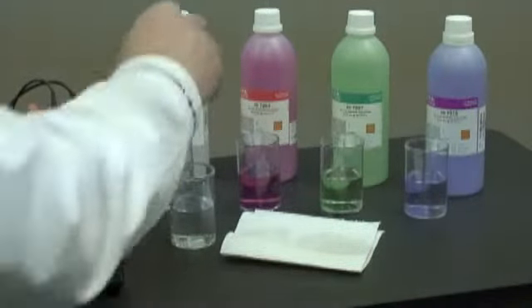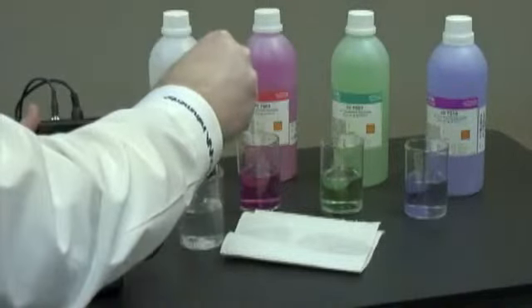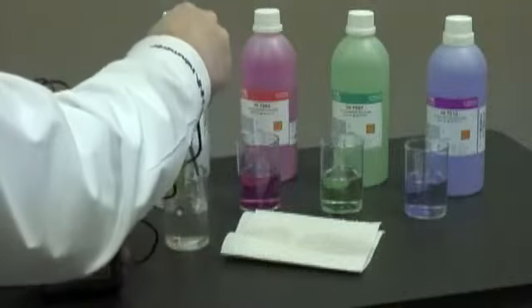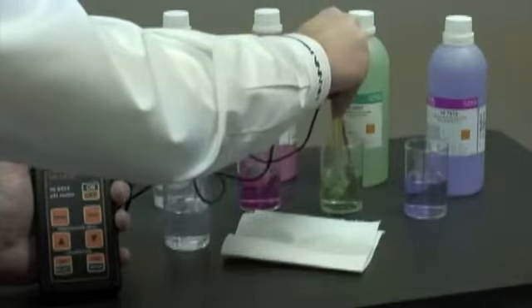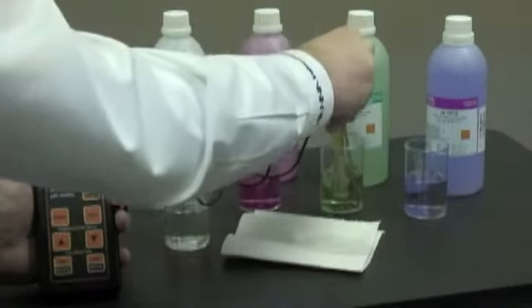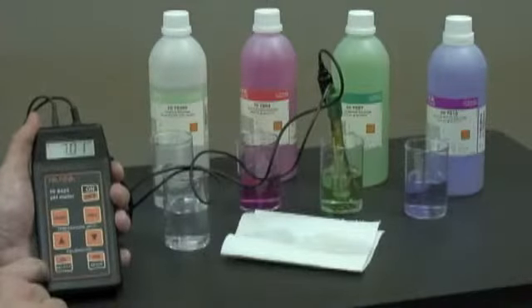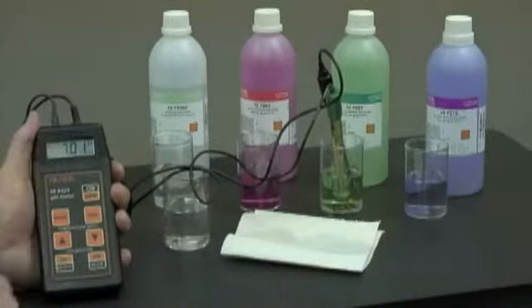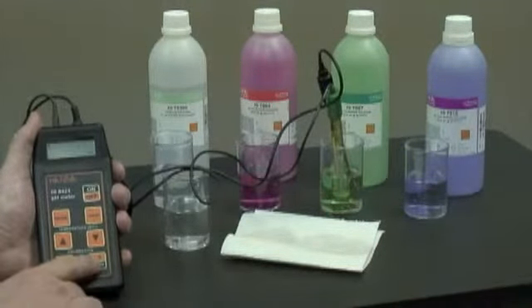Now that two hours has passed, we'll rinse the probe with some purified water and place it in the pH 7 buffer. We'll hit the calibration key and we'll wait for a CFM to show up on the display. Once we see that and it beeps, we'll hit the confirmation button.